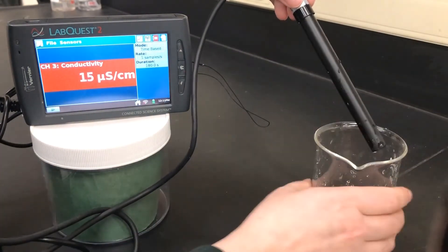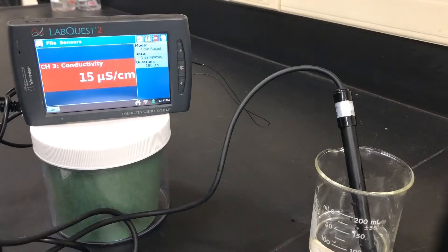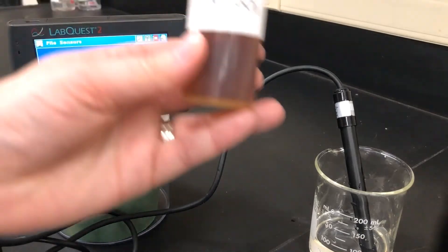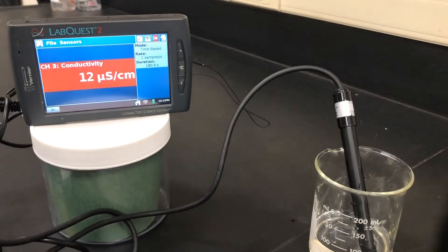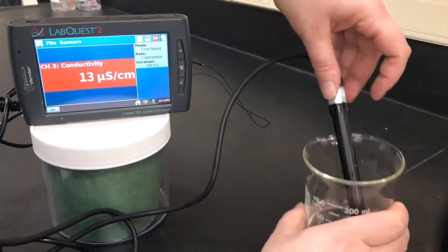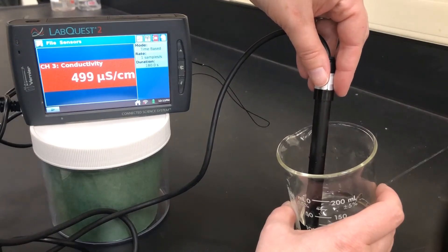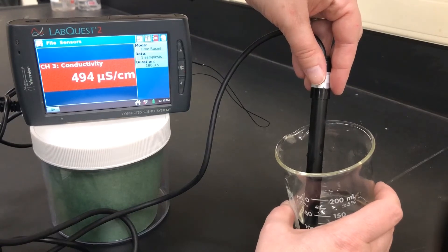For my final trial, I have a new beaker of 70 milliliters of deionized water. Our initial reading of zero drops is holding steady at 12. We will now be using one molar of iron 3 chloride, doing the same process as before one drop at a time. Here's the first drop of iron 3 chloride — this has a really pretty amber color. For one drop of iron 3 chloride, our conductivity is 494.